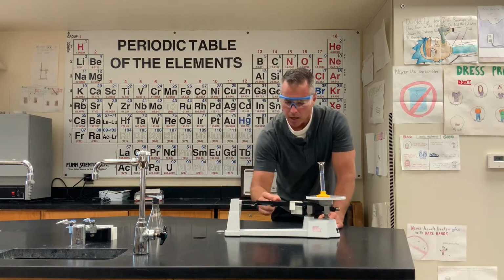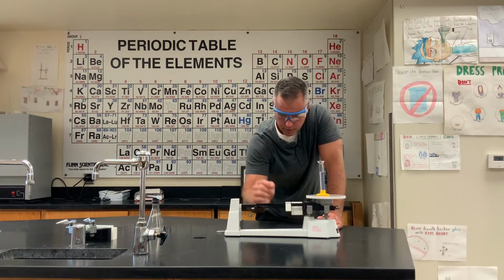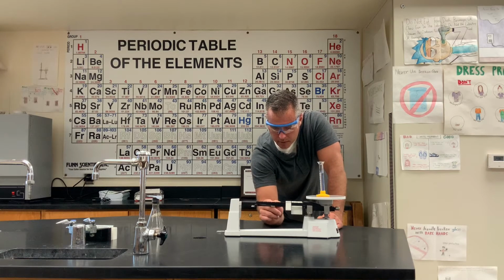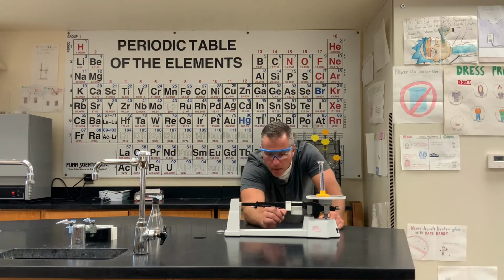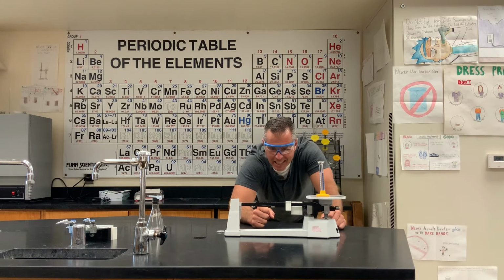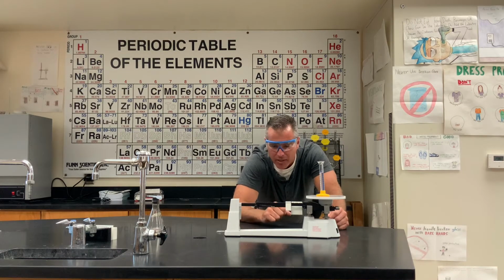Stay there. All right, so it was at 28. We're now at 36.91, just over the 9.